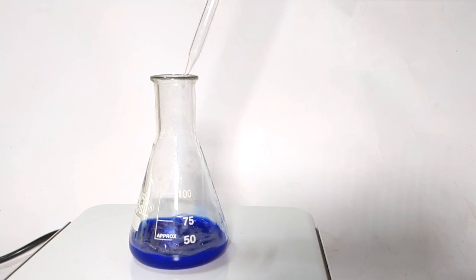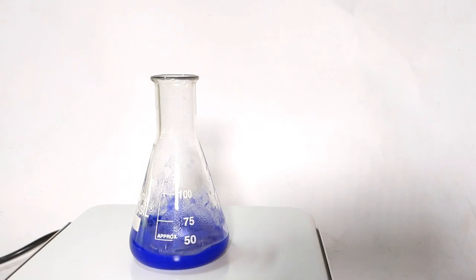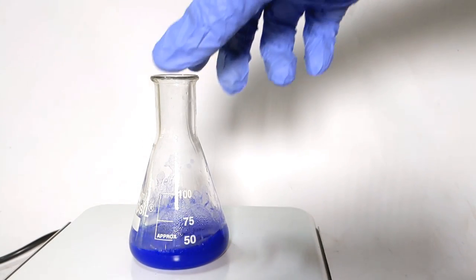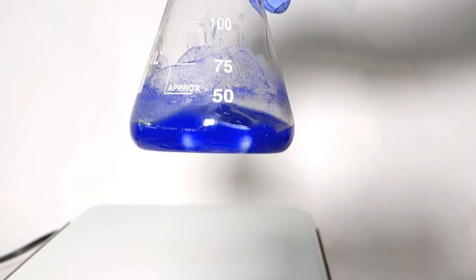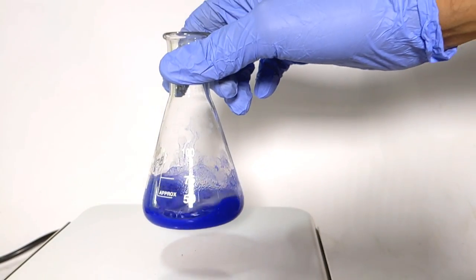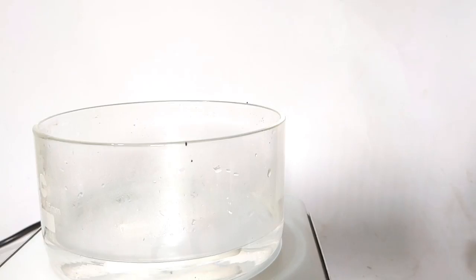The product you obtain here is relatively pure, which you could merely filter and wash with diethyl ether and store. But I wanted to get the crystalline product. I have read in certain literature that it forms beautiful deep blue needle shaped crystals. So I decided to try that out.